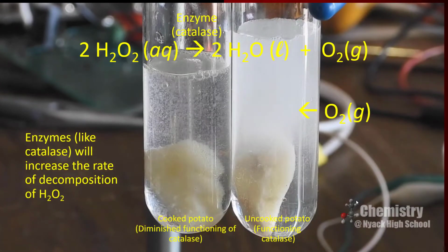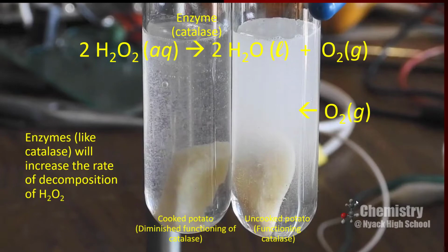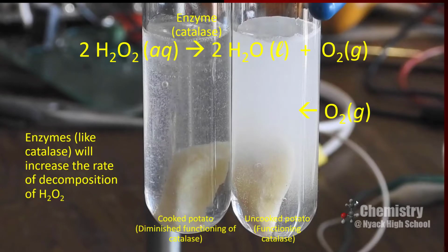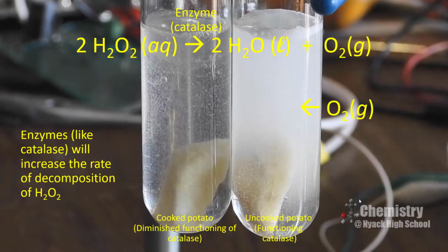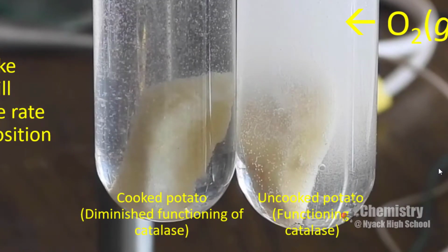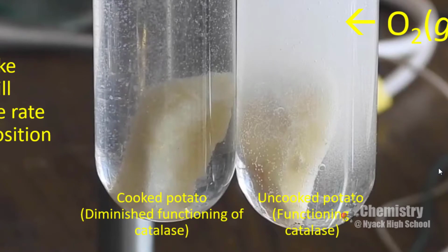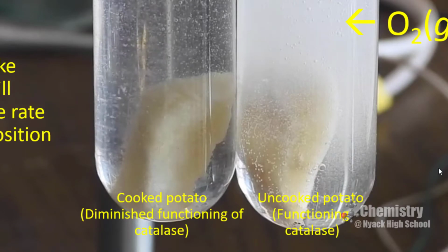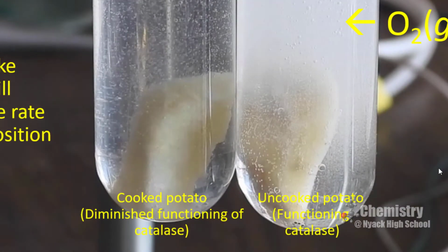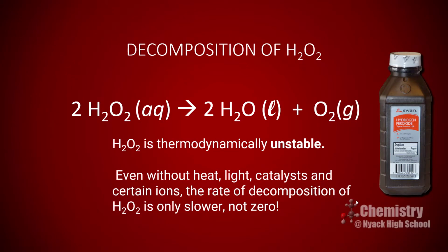The enzyme catalase can be found in nearly all living organisms. Catalase hastens the decomposition of hydrogen peroxide. This video shows the difference in the rate of decomposition of hydrogen peroxide in the presence of catalase found in a piece of potato and without. The slice of the potato on the left has been cooked, which denatures or degrades the enzyme so that it is no longer functioning. The slice on the right shows the decomposition of H2O2 in the presence of catalase in a potato that has not been cooked. Yet even without a catalyst, hydrogen peroxide decomposes because it is thermodynamically unstable.